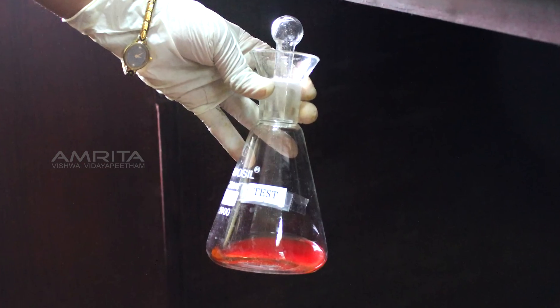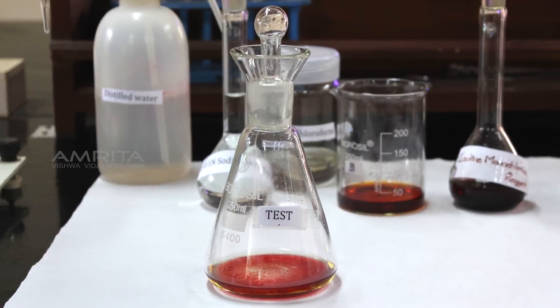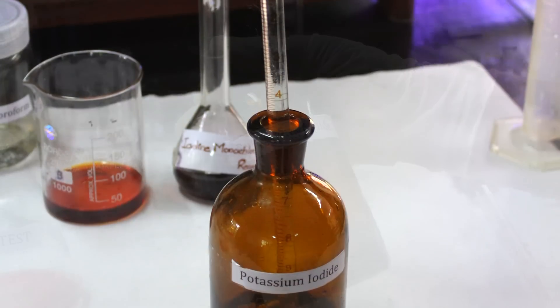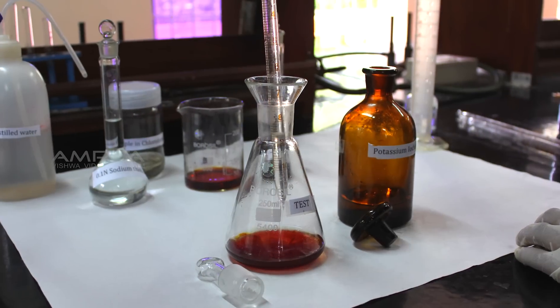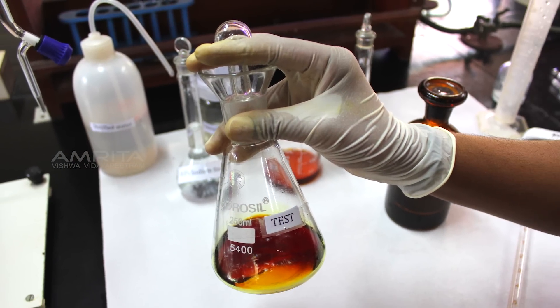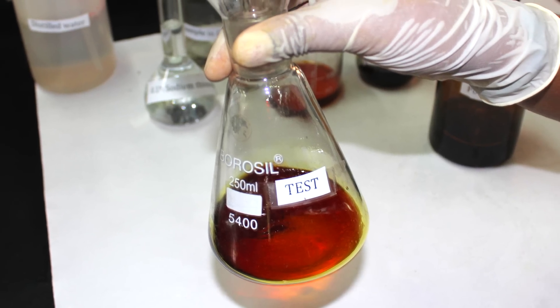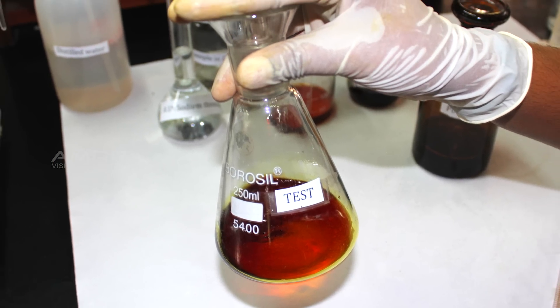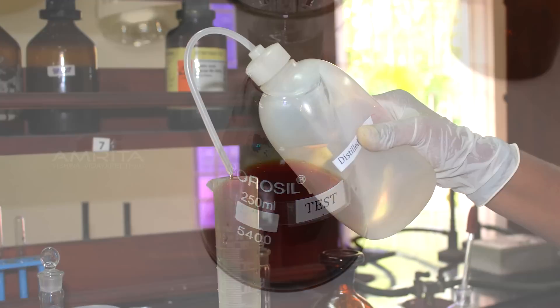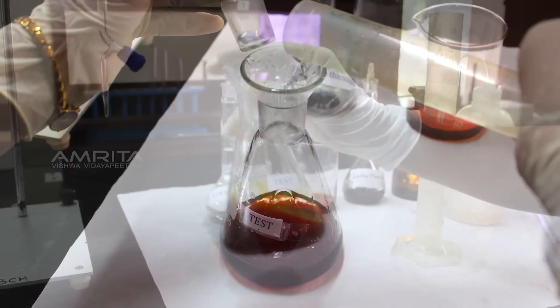Take out the flask labelled test after 30 minutes incubation. Pipette out 10 ml potassium iodide solution into the flask labelled test. Stopper the flask and gently swirl it to mix the contents well. On mixing, the colour of the solution in the iodination flask changes to dark red brown.